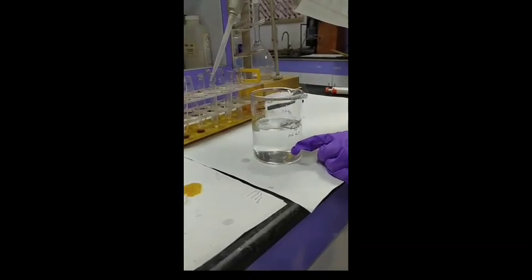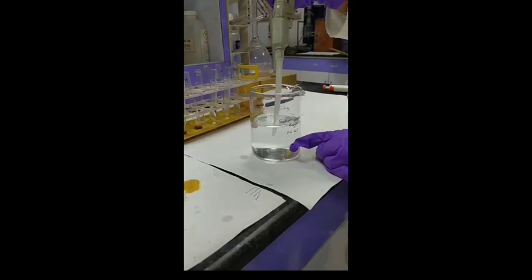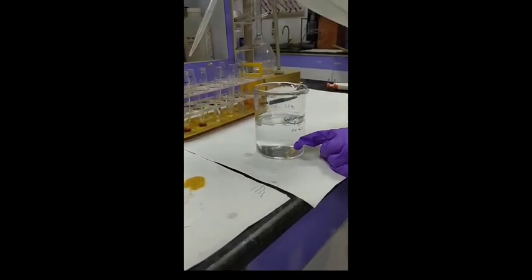And now we are going to pour 4 ml of sodium acetate buffer adjusted to pH 4.5 in one test tube of the sample and one in the blank.